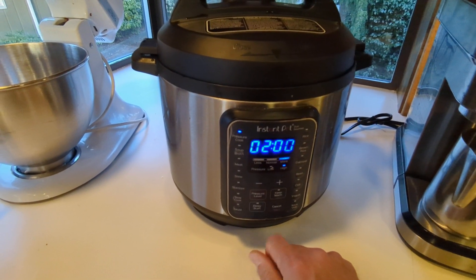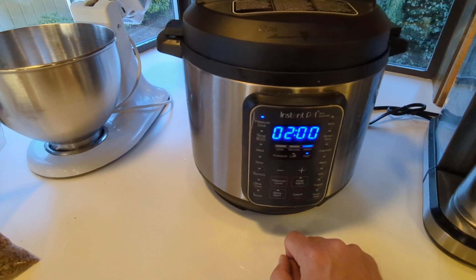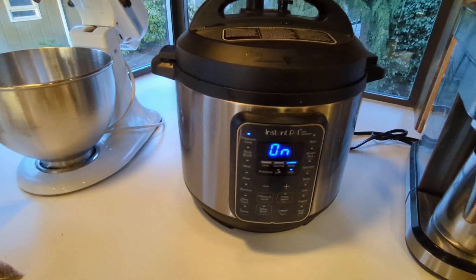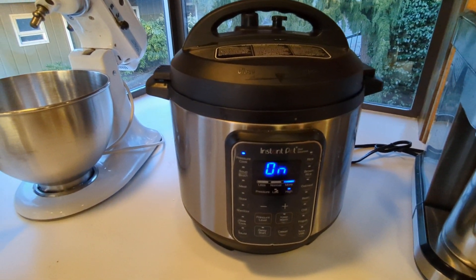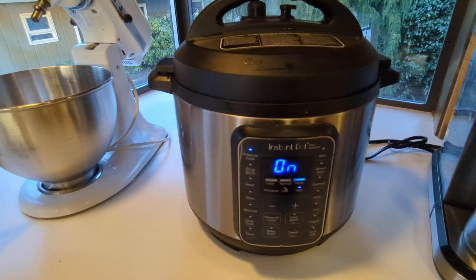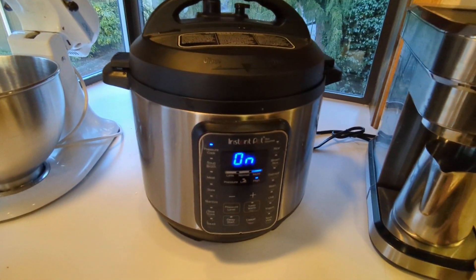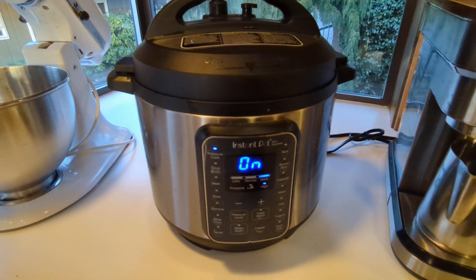So a good 120 minutes — two hours. We turn the keep warm off and at this point we don't really have anything else to do. A stovetop pressure cooker you want to keep an eye on, but this you set it and forget it. I'm just going to go about the rest of my evening. When it hits that two hour mark it's going to shut itself off and come down to temperature. I'll be able to come back and take my sterilized jars out and work them when I'm ready. Super easy — that's why I'm an advocate of the instant pot, even though they are obviously smaller than a conventional pressure cooker. Convenience is worth something to me. Thanks a lot.